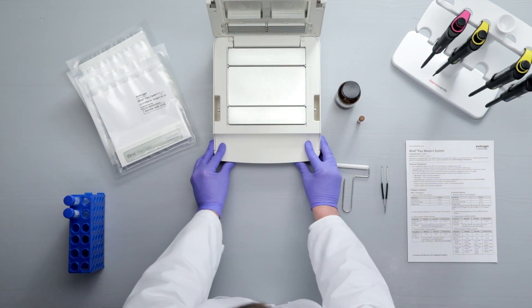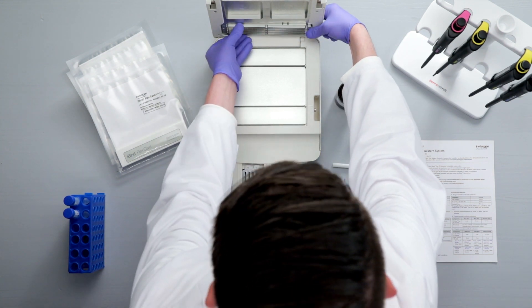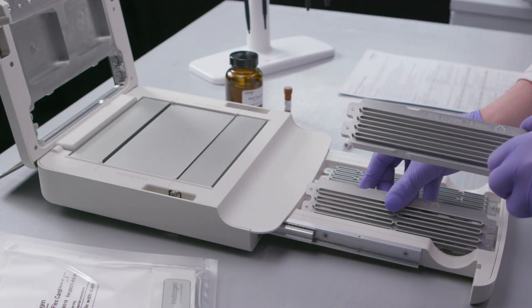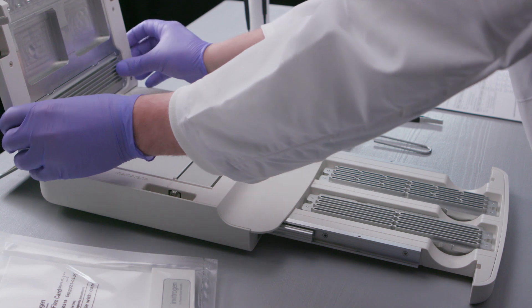To access the different inserts, open the spring-loaded storage drawer. To change the inserts, push out from the inside of the top lid and drop the new insert into place. Note that it can only be installed in one orientation.